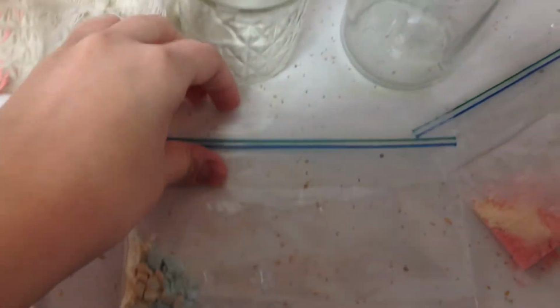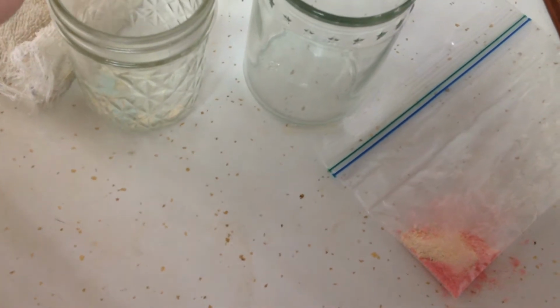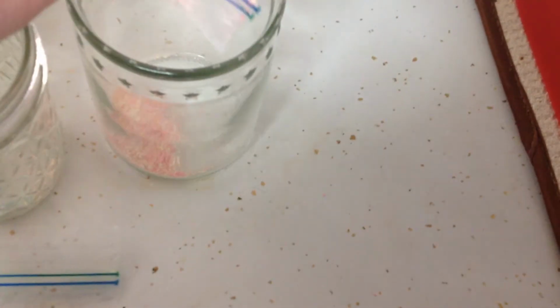In my second container, I've crushed the tablets up a little bit, so we have some really big chunks. I'm going to put those in my container. I'm going to make sure they spread out a little bit here. And in the last one, I took 2 antacid tablets and I crushed them up into a very fine powder. I'm going to pour those in my last container here. Again, I'm going to make sure it kind of spreads itself out here so that it's nice and across the entire bottom.